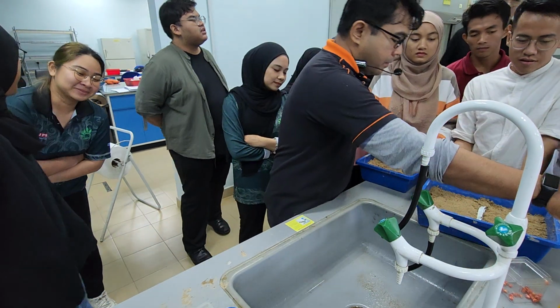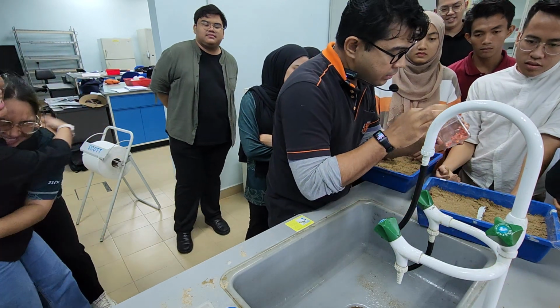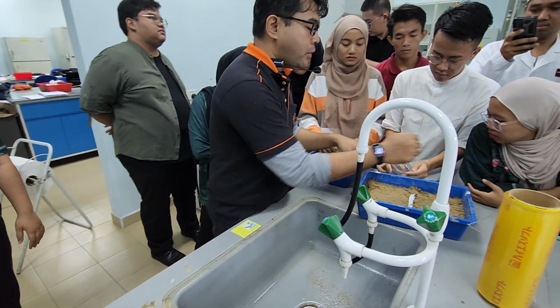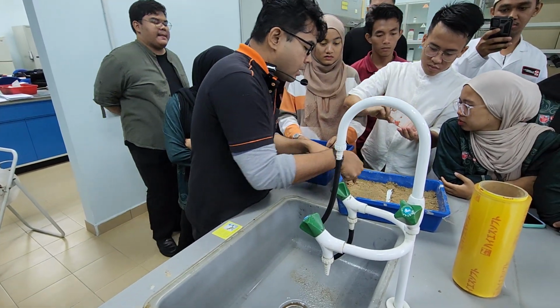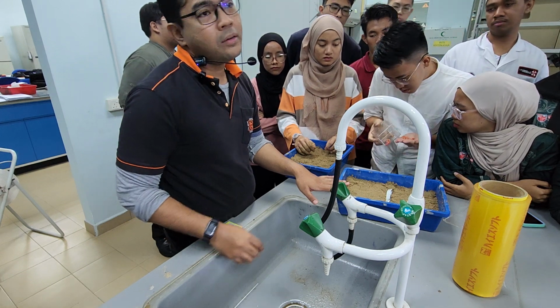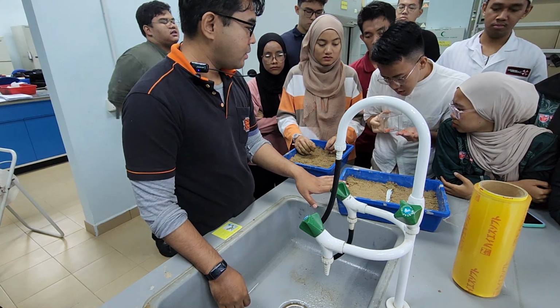Okay. So how many seeds? I wonder how many seeds. Cuba kira. Okay, can you come? Put it half. Apa? This is another reason kenapa kita tak soak ni.